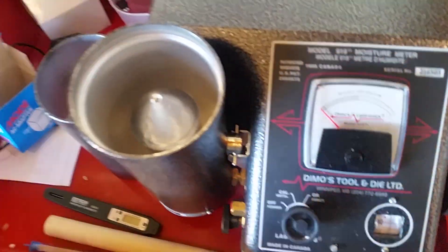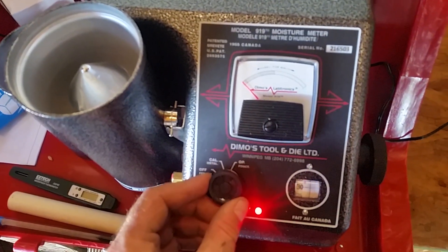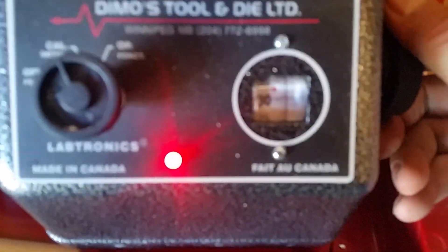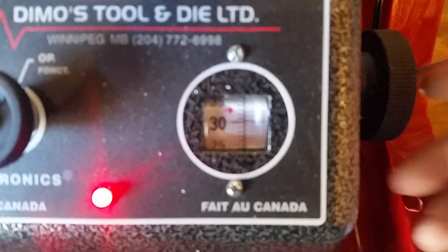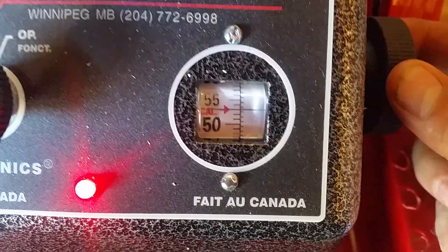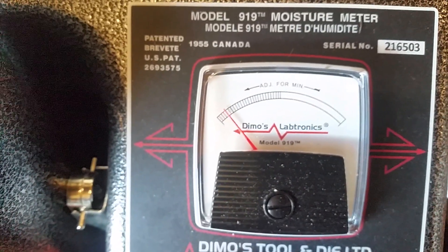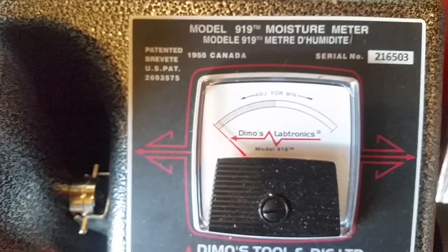This new one is bolted right into the case, so it stays in there nice and steady, and the scale goes in there too. You need a scale. The first thing we do is turn it on to calibrate — turn this dial to calibrate, get it right on there, grab this piece, make sure it's at the lowest point, and you're done. Then you turn it to operate.